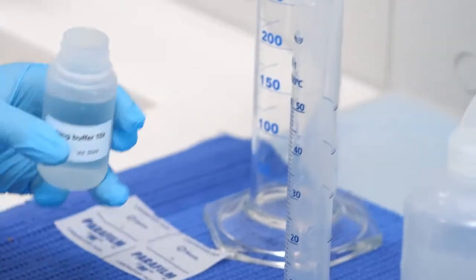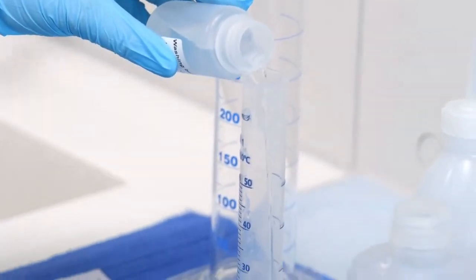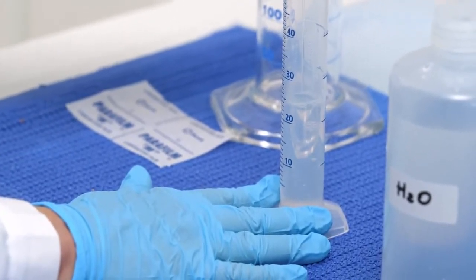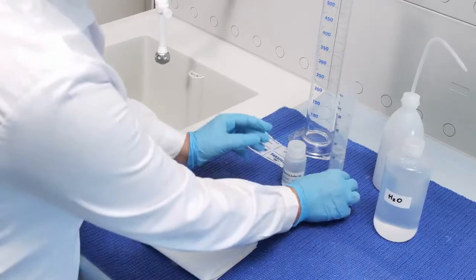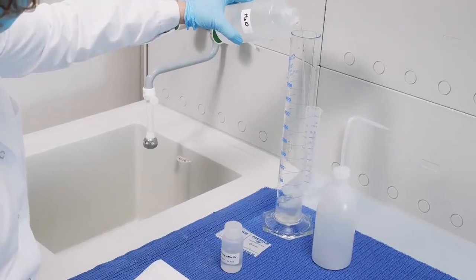In the meantime, prepare an adequate amount of washing buffer by diluting the concentrate reagent provided in the kit. For routine analysis, you can prepare a bulk. The diluted washing buffer is stable at room temperature for 1 day and for 2 weeks if stored in the fridge.